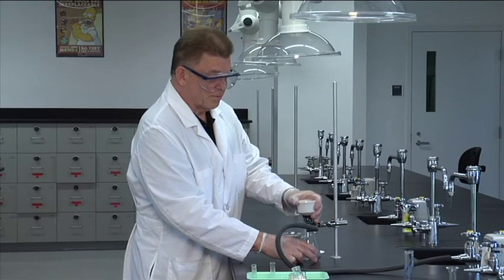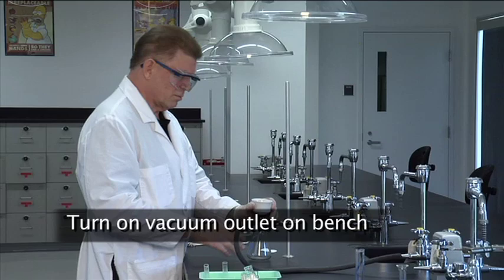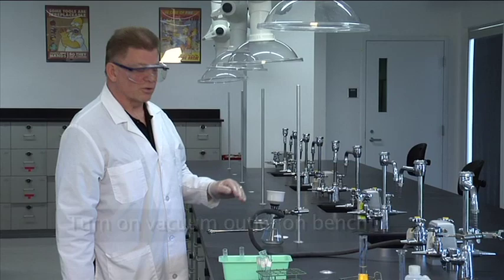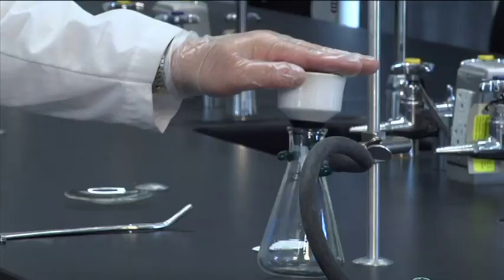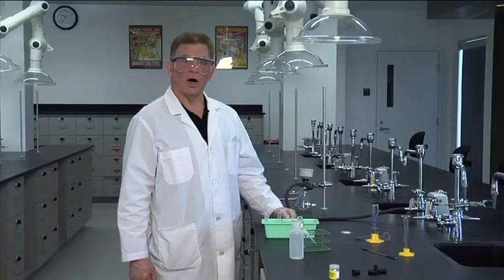Now we can turn on the vacuum. Here's a little experiment I like to do because I have a low threshold of entertainment. See that? Now you have a vacuum. You know you have a vacuum. All right.